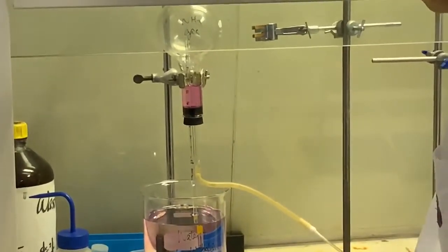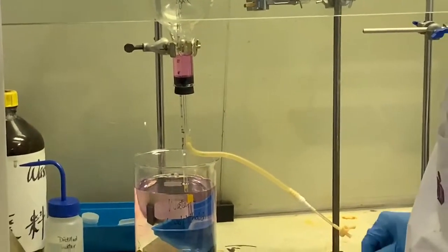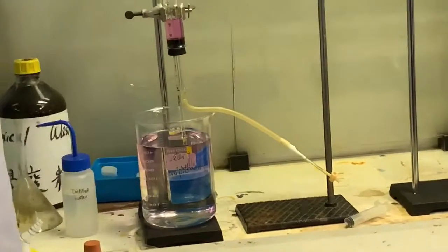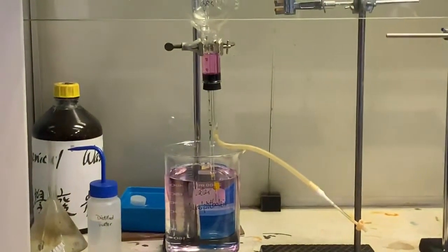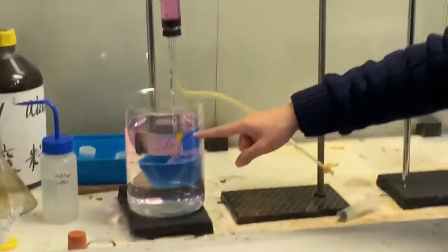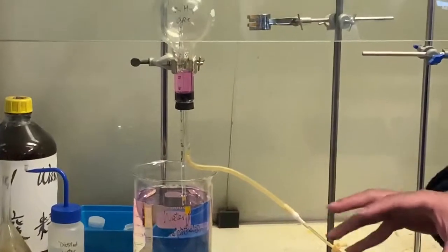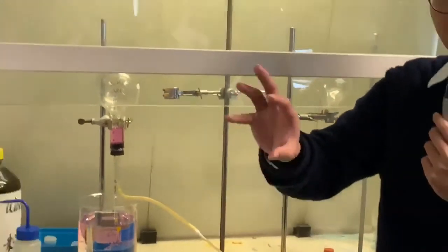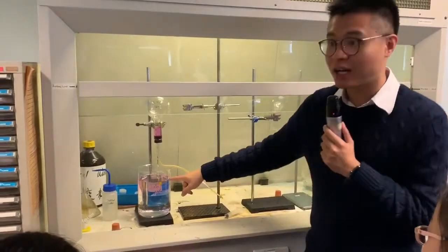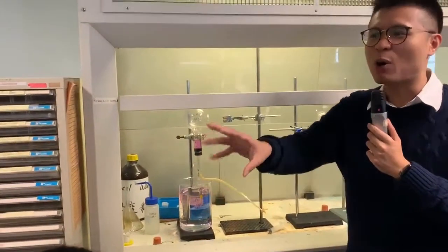That's really so happy. This is a fountain. Is that it? Still open? Yep. Why do you find a pink color? Because... it's a pink color. Okay, so that's why you see pink color. It's magenta. It's like purple, right?